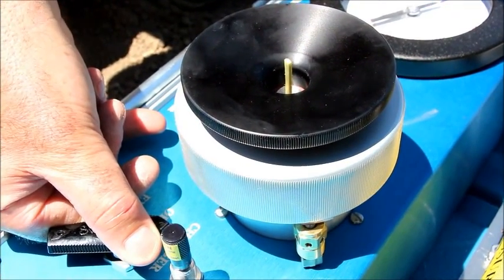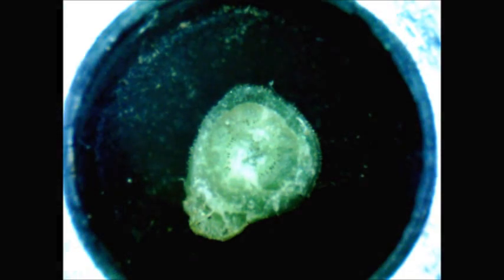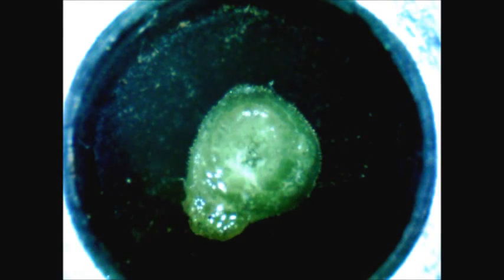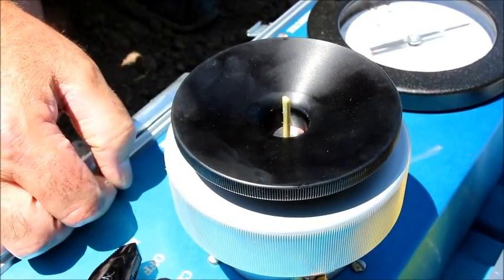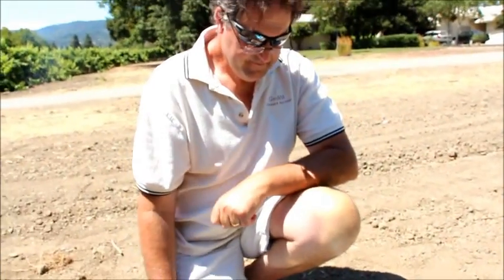We're just watching for water to come to the cut surface of the petiole — and there we have it right there. So about 12 and a quarter bars. Dana, what are your thoughts on that reading? 12 and a quarter bars for a vineyard that is three weeks pre-harvest and has just been irrigated is a pretty good number for midday leaf water potential.